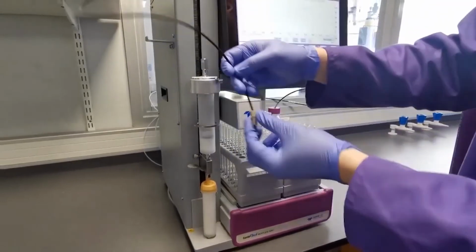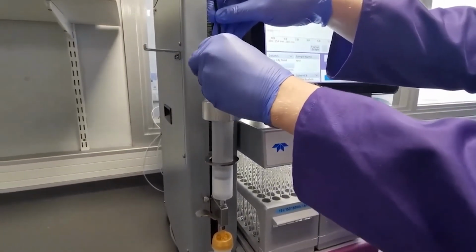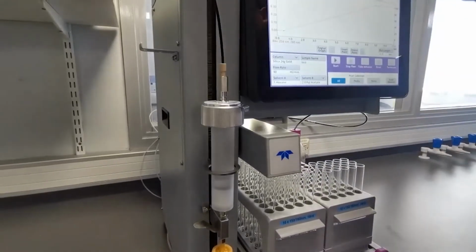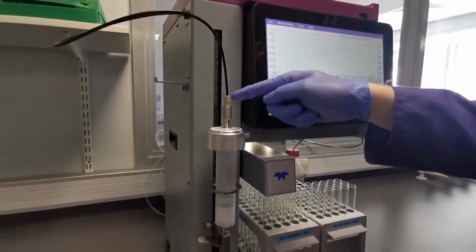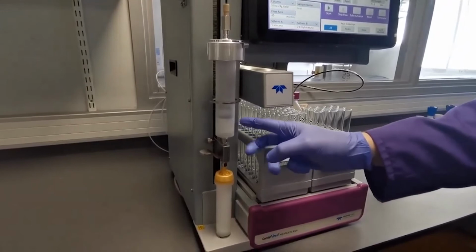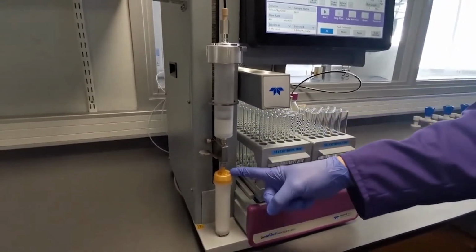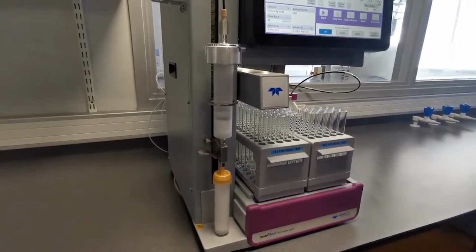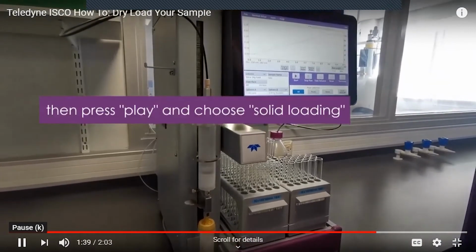We then use the tubing to connect to the top so that after the equilibration is done, the system will divert the flow through the bulkhead, round this tubing, through your dry loading cartridge, and load your sample that you've prepared directly onto the top of the column for the purification. We're then ready to set our gradient up on the system in order to run our sample.